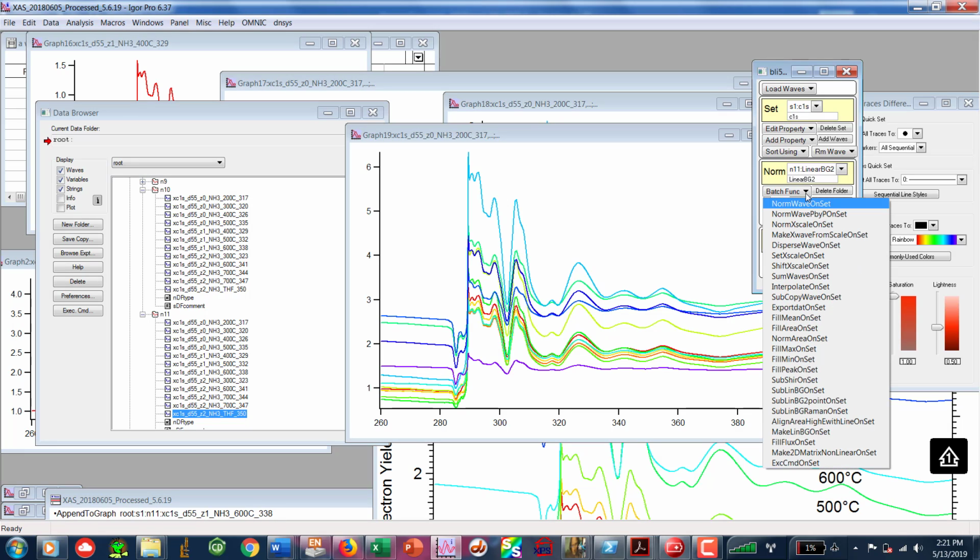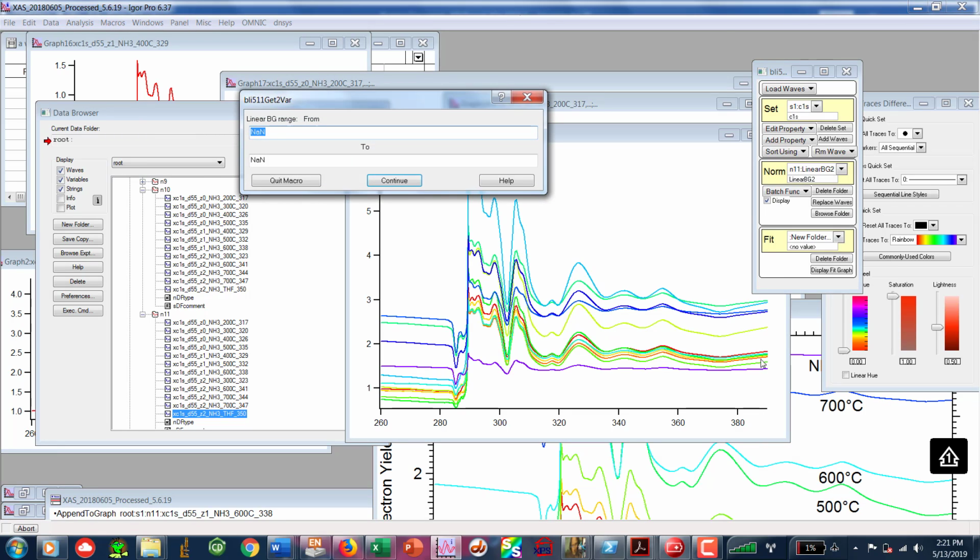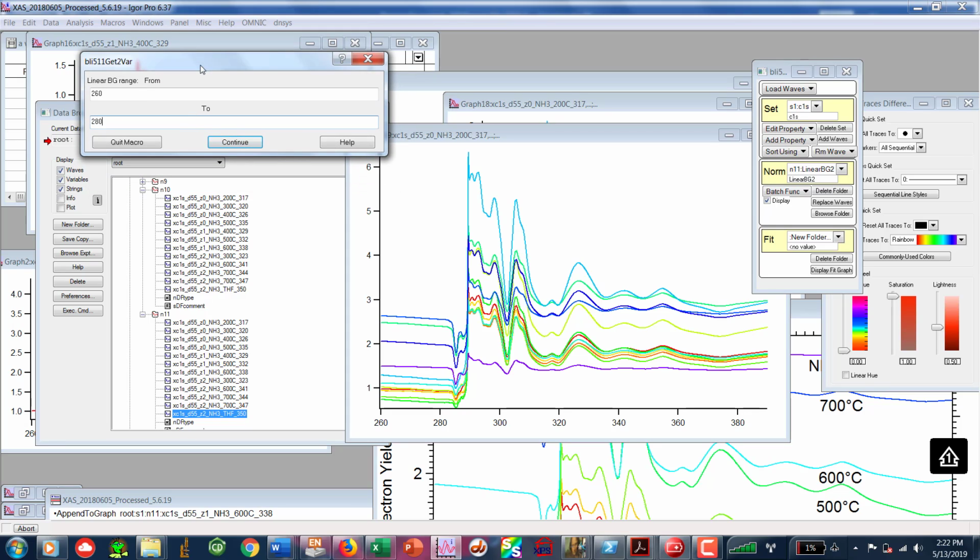I'm going to go back to batch function, and I'm going to go to our classic SubLinBGOnSet. And what I'm going to do is I'm going to go from 260 to 280, which should be that pre-edge area in which we've got no work readily being done, and we shouldn't have any photo emission. And then I'm going to hit continue. Now look over here to the right hand side and see how these guys change in real time as we do the work.